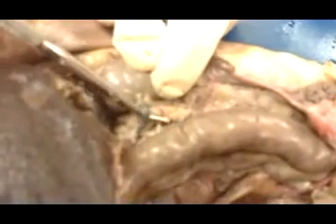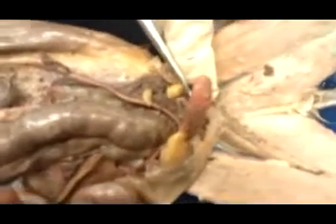Putting this all back together, we see the hilum, the indentation on the outer surface. And at the hilum, you have the renal vein taking blood away. Underneath it, you have, let me clean it up a little bit, the renal artery. Let's do it this way. Renal artery right there. It's bringing oxygenated blood into the kidney. And you also have the ureter. The ureter is transporting that urine all the way down to the urinary bladder here. Now, exiting the body here, out of the urinary bladder, is the urethra. That's going to transport the urine out of the body.